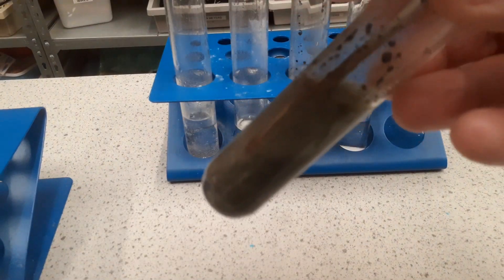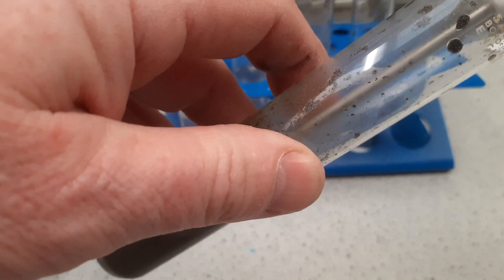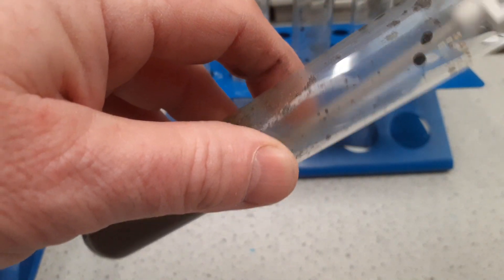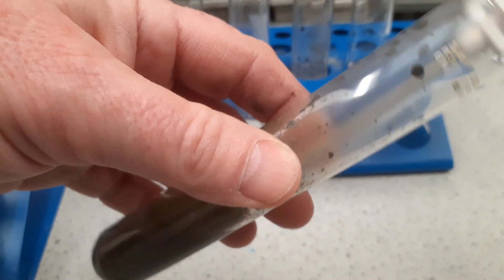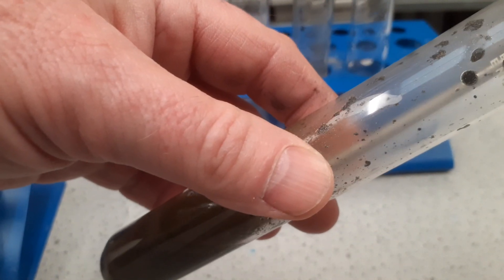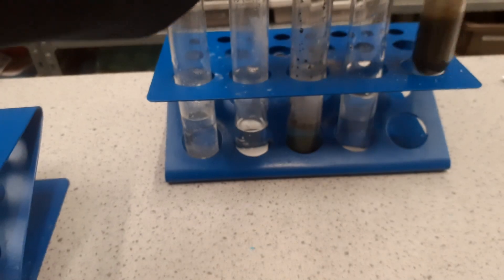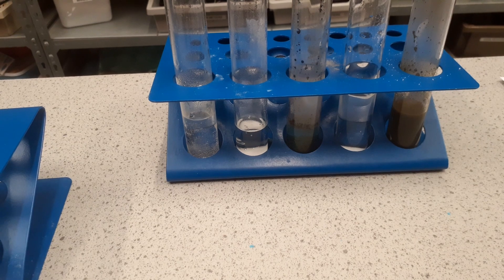We're up to 50 degrees and this is really feeling quite warm. 55. We've hit the 60 degree barrier. It's really hot to my hand now - I wouldn't fancy a shower in this heat. 63. I think we've reached the peak; we don't seem to be rising anymore. No, 63 degrees C. So a big rise on that one - 63.6.